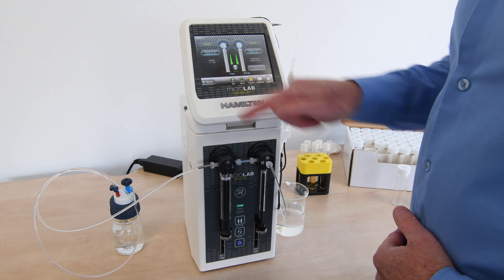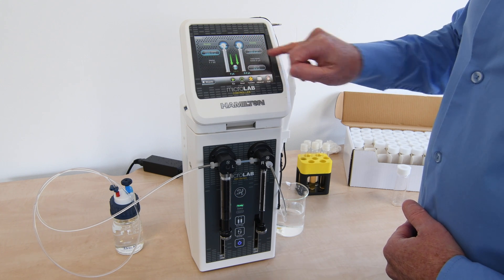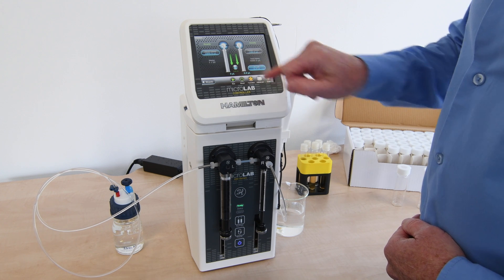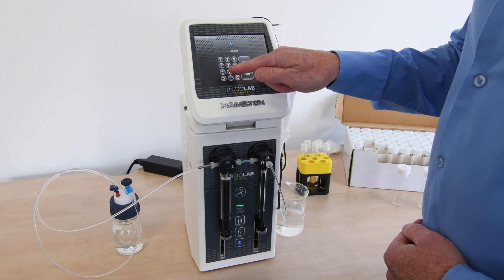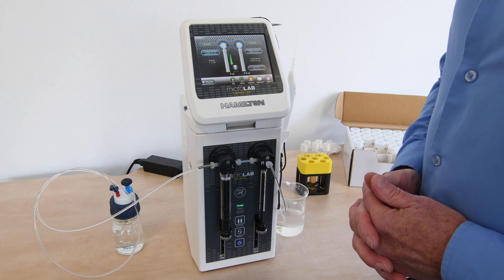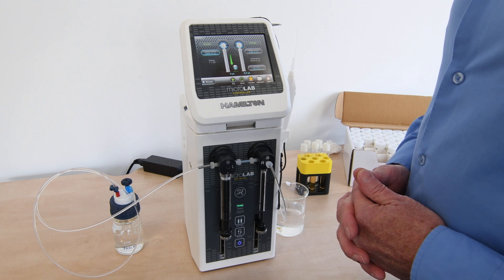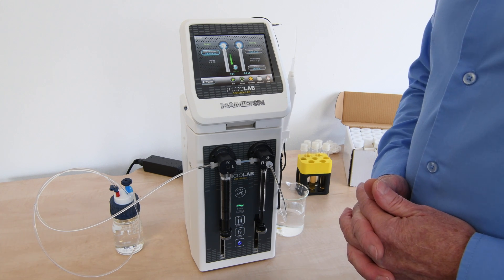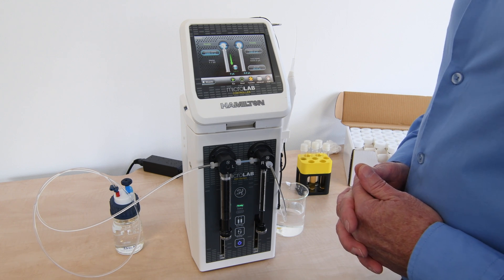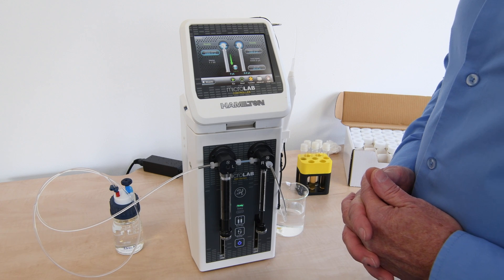Going back to the dilution program, we can see we are still in the standard format of diluent and sample, but we now have an opportunity to introduce an air gap. I'm going to introduce an air gap of 20 microliters. This will aspirate an air gap before taking the sample, to separate the sample and diluent, ensuring mixing only occurs once the material is dispensed from the tubing.